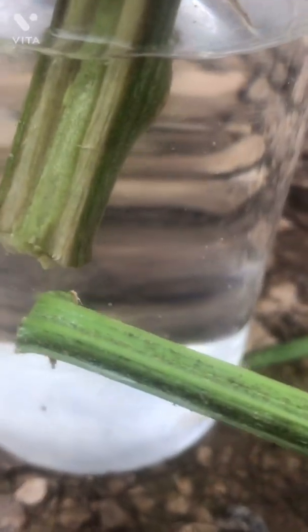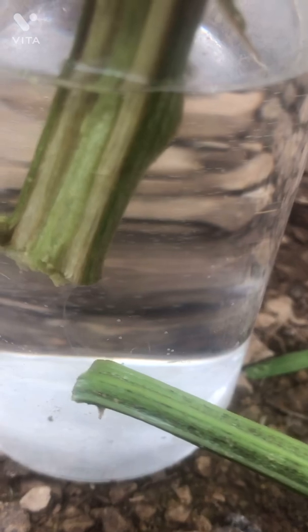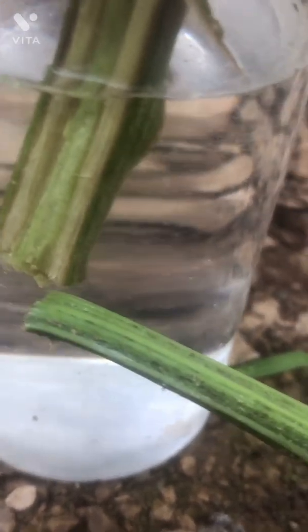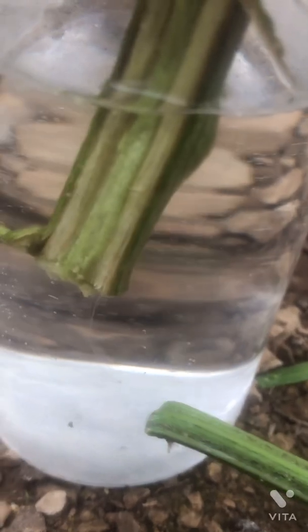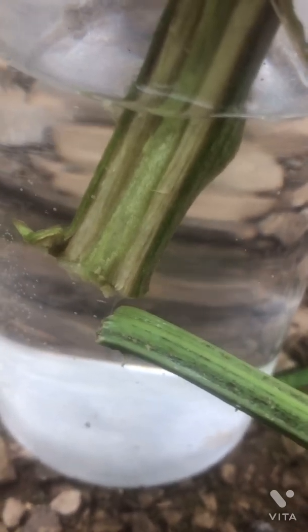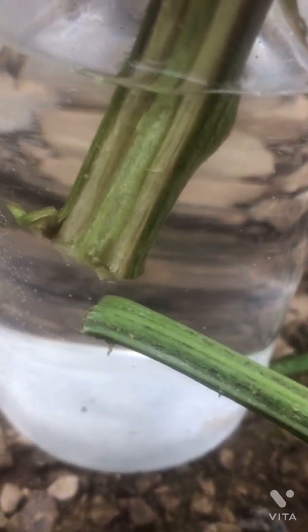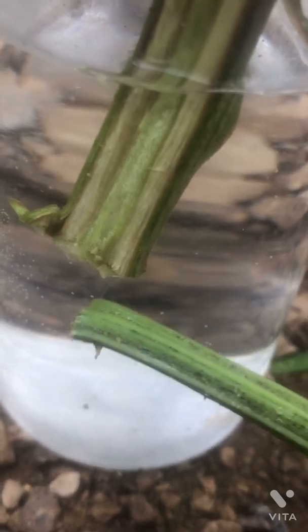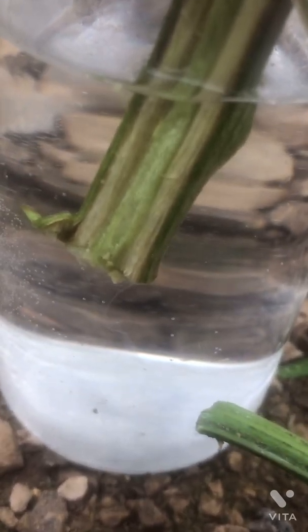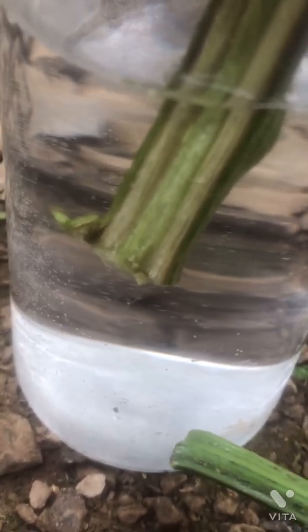We can see the ooze has started — you can notice it is flowing out. The sap is clearly oozing out, and we can say it has tested positive for bacterial wilt. This is a simple ooze test to confirm whether this is bacteria or fungi. The sap flowing down confirms the presence of the bacterium — it is undoubtedly bacterial wilt caused by Ralstonia solanacearum.